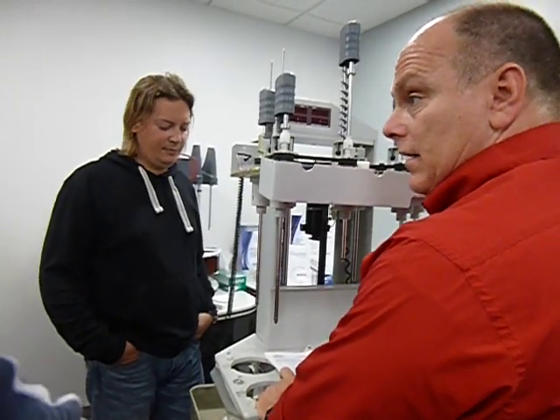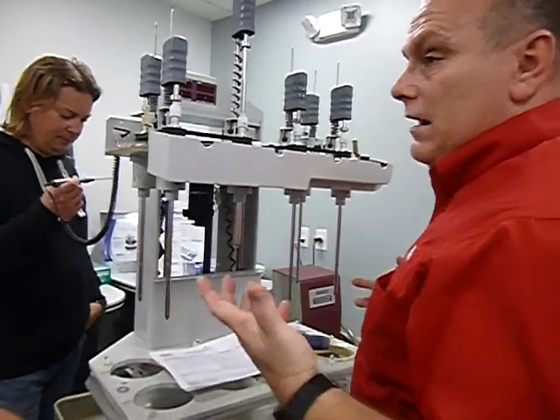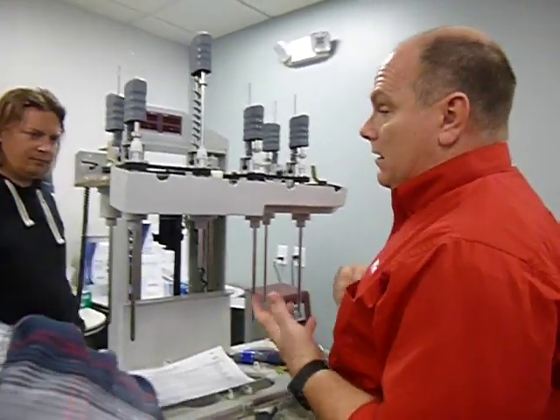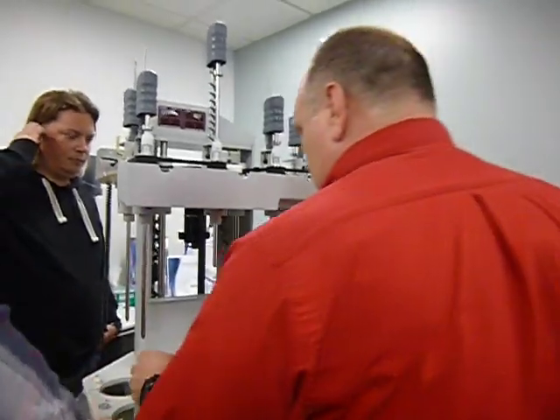Yep, that's how you change the hydraulic actuator. But it's a pain. Like I said, it's a matter of getting everything up and out of the way, and it's not even that, it's the compressing of it. It's a pain to compress that, to get it down and get it up out of the way. So, it makes for a long day.